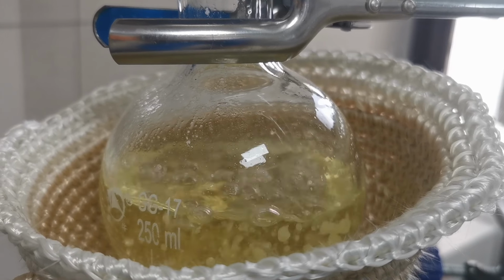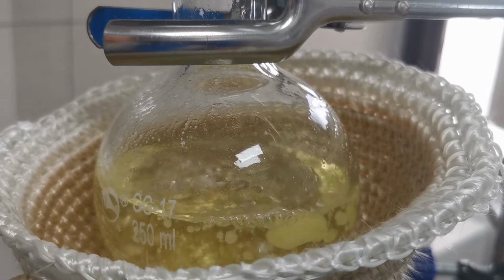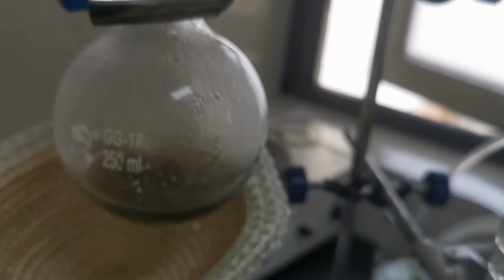The next day, I set up a distillation apparatus and distilled until the temperature reached above 80 degrees Celsius, which is the boiling point of the DCE. After the solvent distilled off, the liquid darkened, which indicates that my lab was, well, invaded by the god of yellow chemistry and is obviously not a good sign.